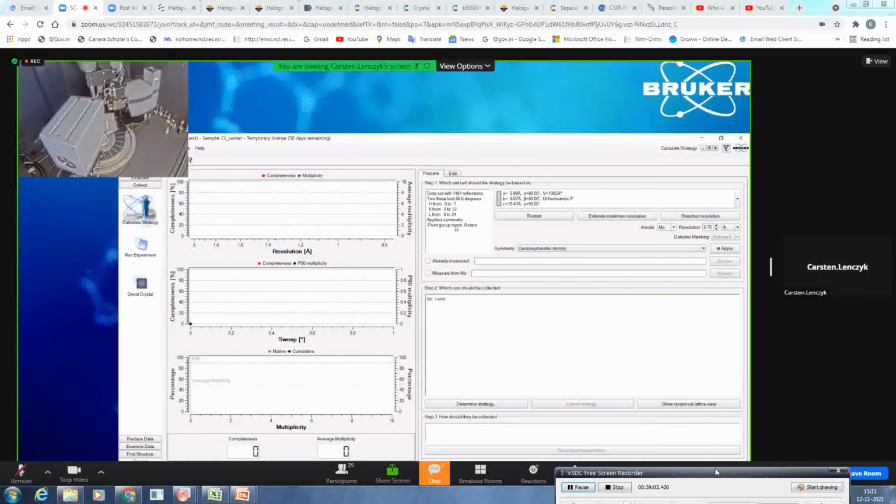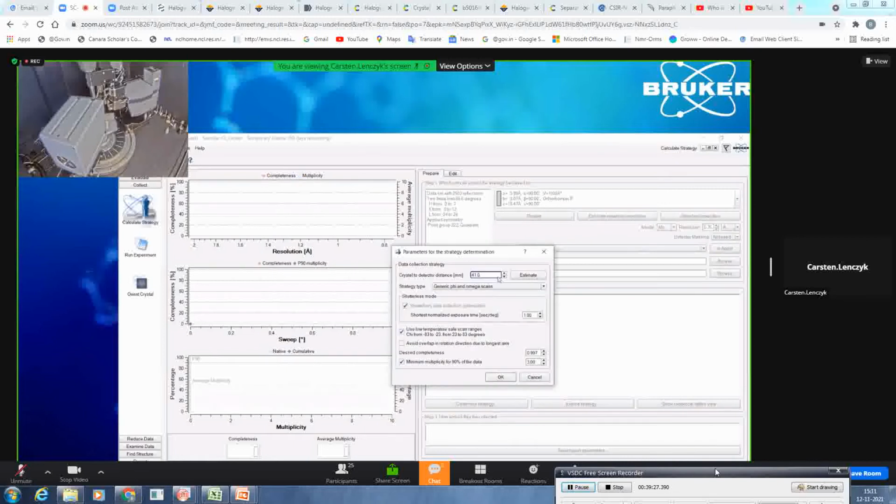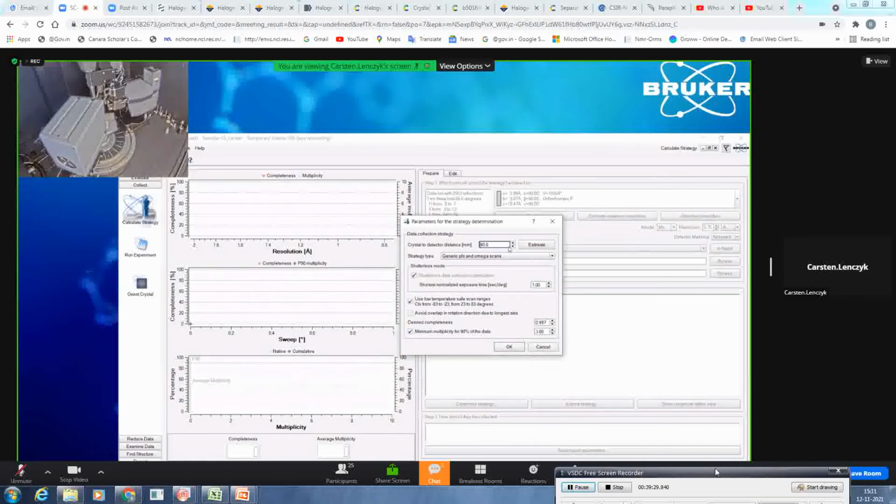You will also get the information how much of the Ewald sphere it will collect. In that case, for centrosymmetric, it only needs half of the information, so it will now collect an octant. If you go for chiral, it needs a quadrant, so double the amount. So here is the unit cell you determined earlier. If you click apply, you can now go to determine strategy. As said, 40 millimeters is totally fine for the detector distance because the spot separation was good enough.